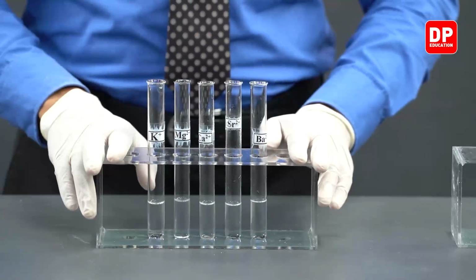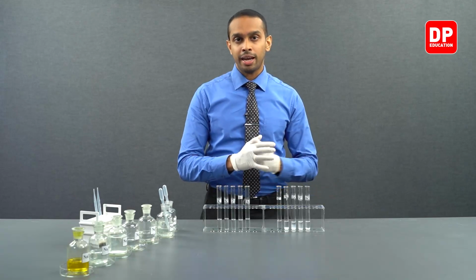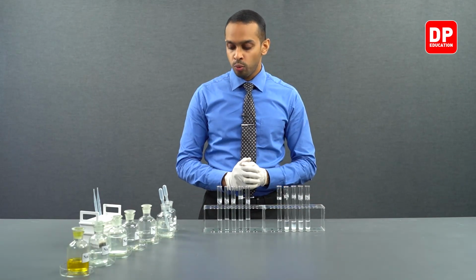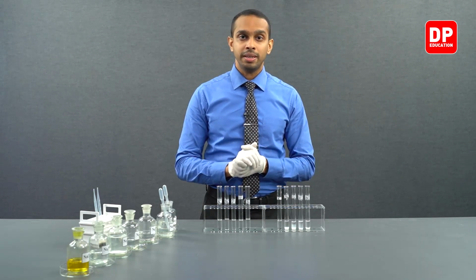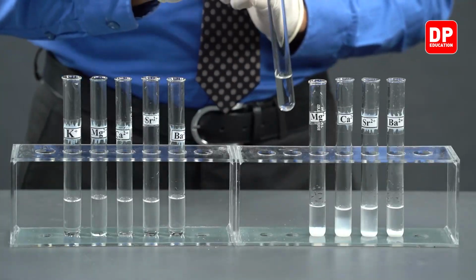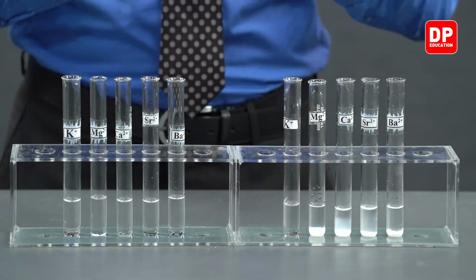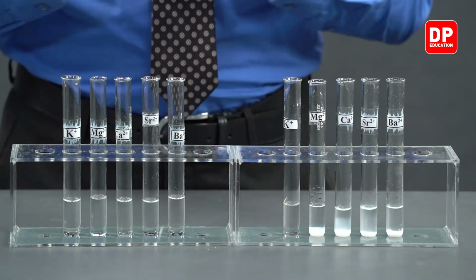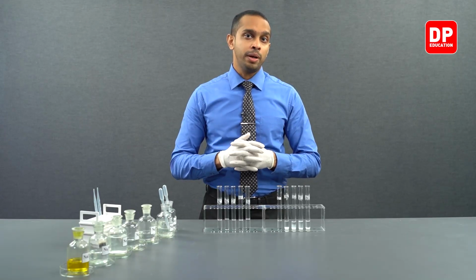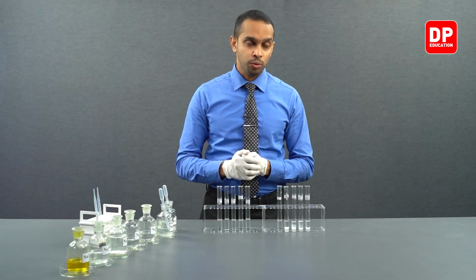Before this experiment was done, we took the same cation solutions and reacted them with sodium carbonate. And we saw, except for the potassium 1 plus ion solution, the rest of the cations formed carbonates that were insoluble in water. Actually, the solubility of carbonates of group 2 compounds decreases as you go down the group.